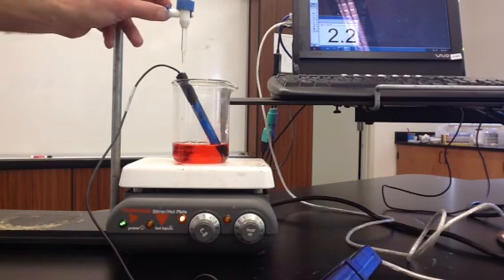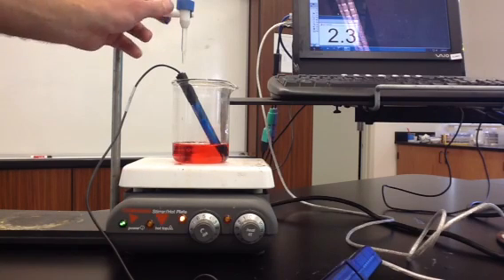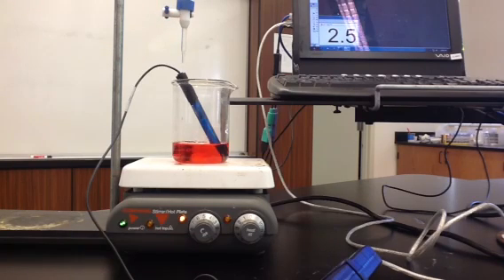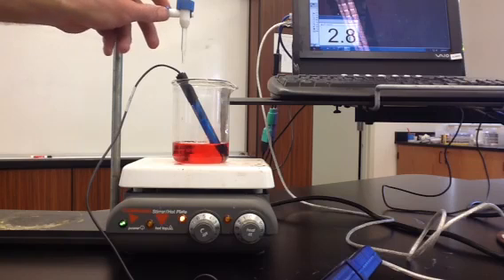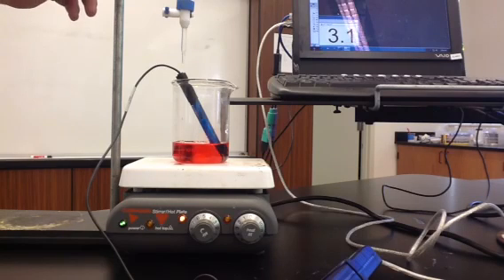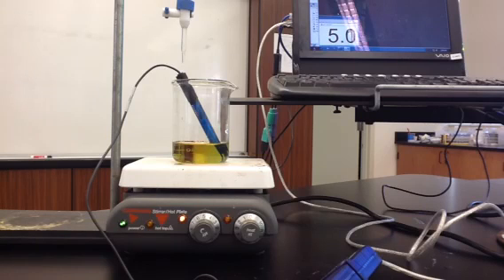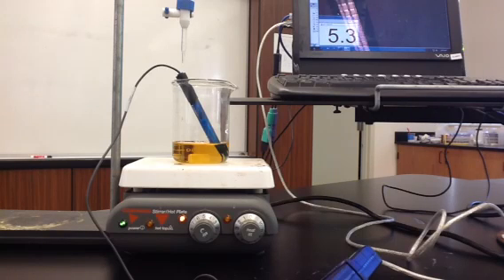Twelve milliliters of base. Thirteen. Now at 18 milliliters — we're seeing a color change occur. That's 18 milliliters of base. We see the color has just changed pretty drastically, and the pH is starting to rise a lot more quickly. It's now at 5.3.